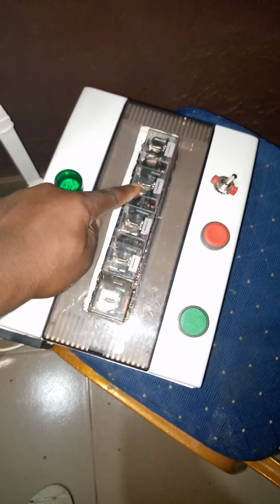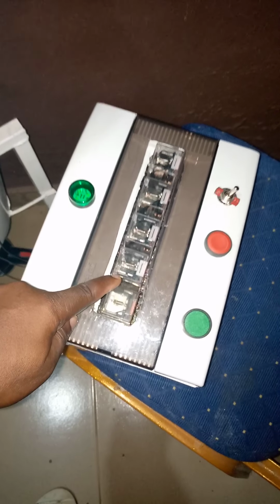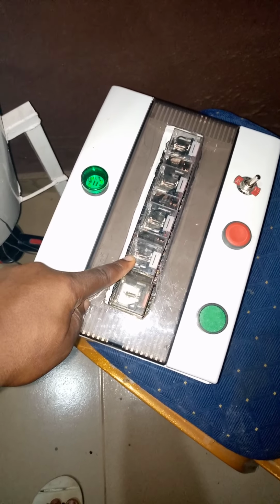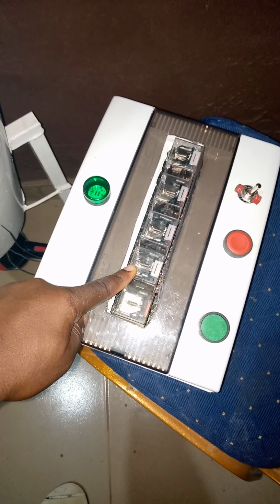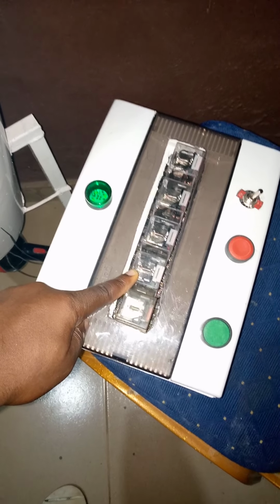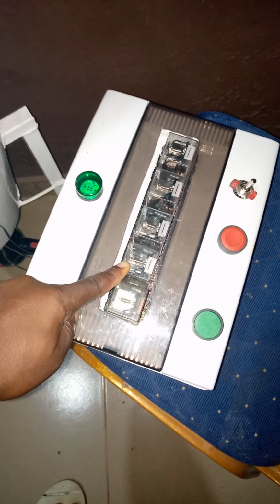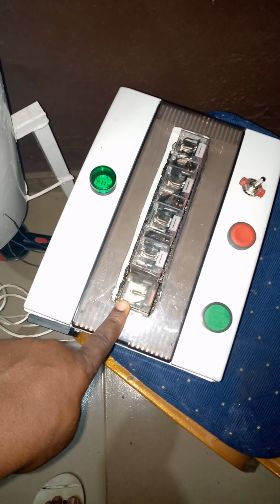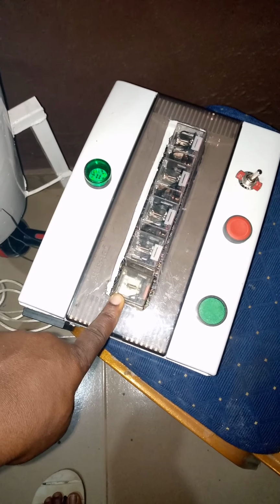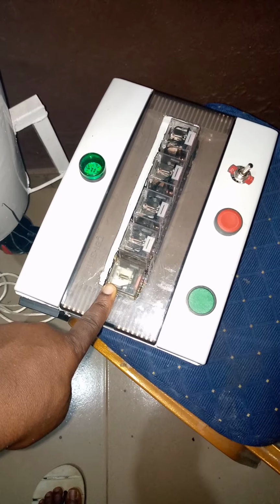Once these two relays are energized, it signals this, which then energizes and then shuts down the fourth relay, which is the main relay here that controls the drying procedure. This fifth relay is a spare relay that is included in the module.